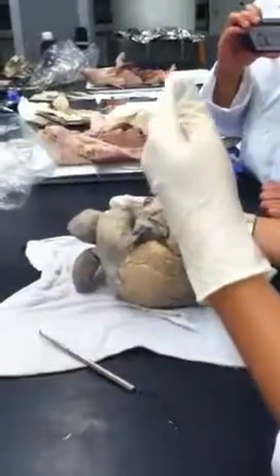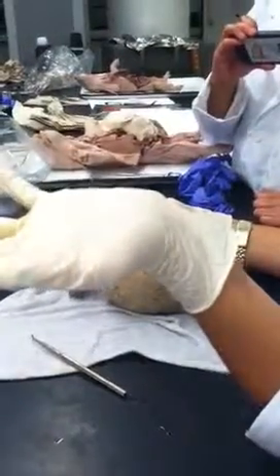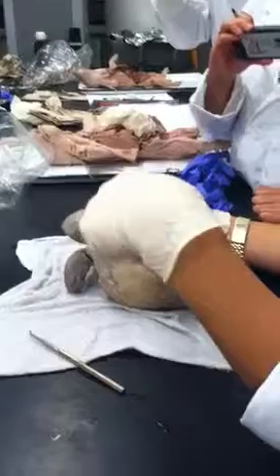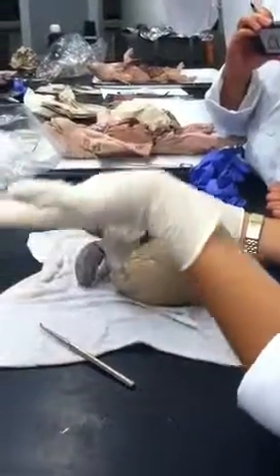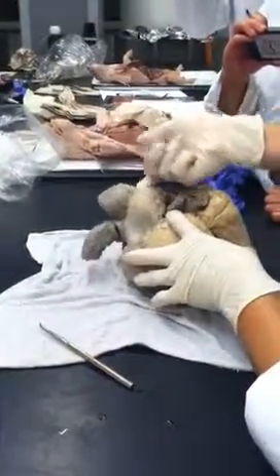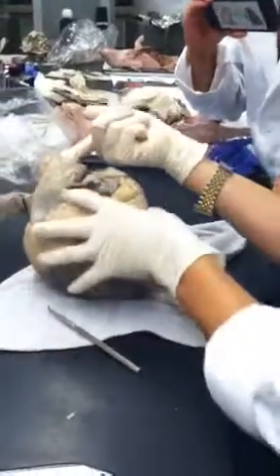Okay, so in the fetus, what's the other option? Instead of pulmonary trunk into pulmonary arteries, there's something else it can do. It goes across to that, the ductus arteriosus. So would we see a ductus arteriosus here? No, we would see the ligamentum arteriosus. Right, exactly. So the ligamentum arteriosus is this thing. Pretty crazy, right?